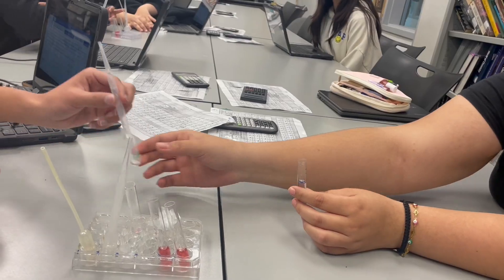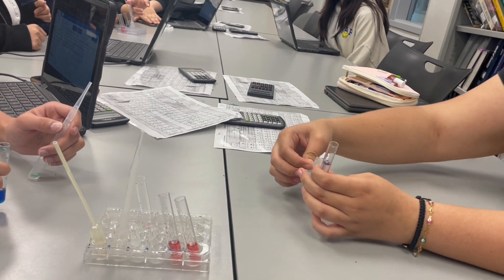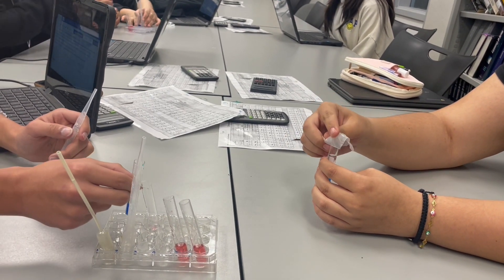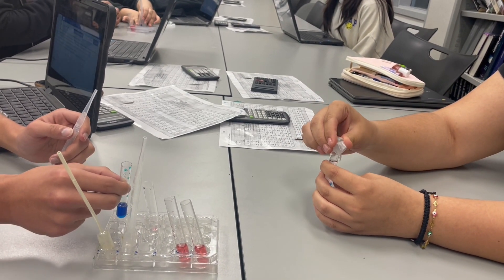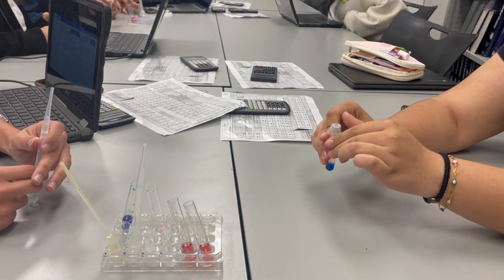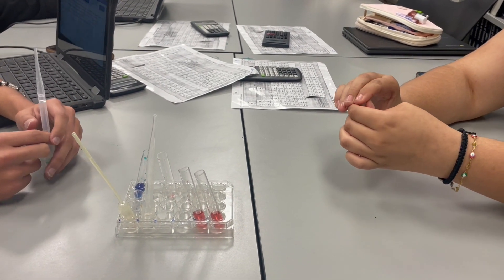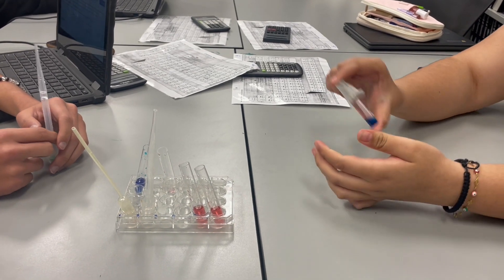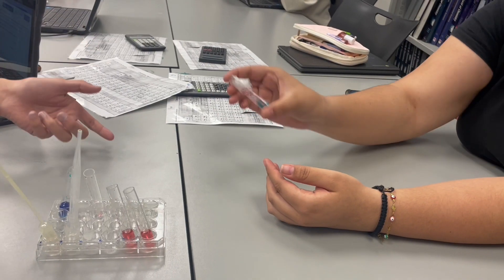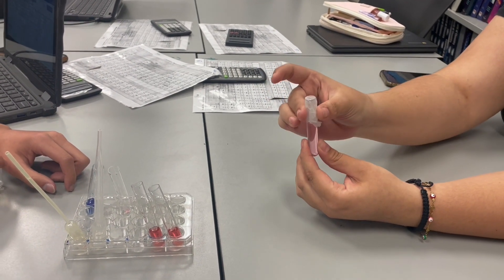There you go. Add all the water in — all of it. Put it on top. There's still a little, it won't do anything to it. Seal it up very well, then mix. It's warm. Mix like that. There you go — perfect. What color do you see?